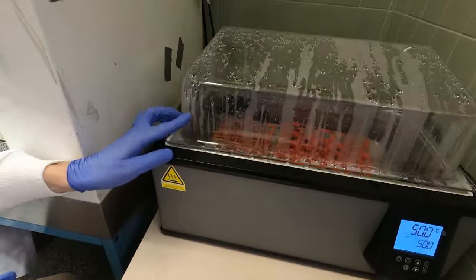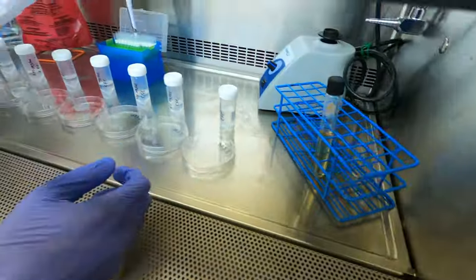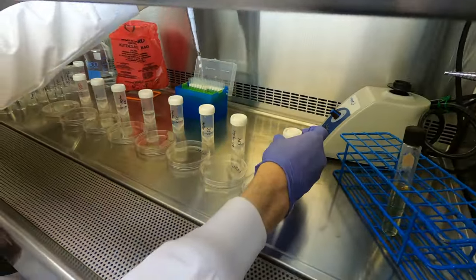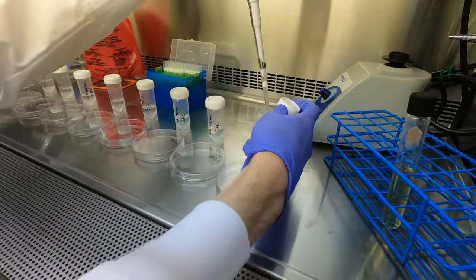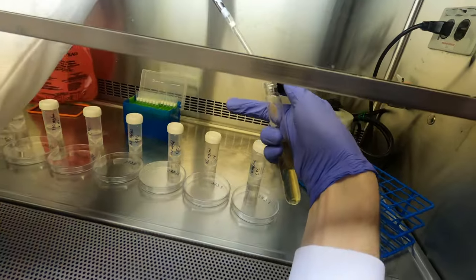We now add 2 milliliters of antibiotic suspension into each 50 degree molten agar tube. We need to do this quickly enough to ensure that our agar doesn't re-solidify, but slowly and carefully enough that we don't get bubbles forming in the plate.